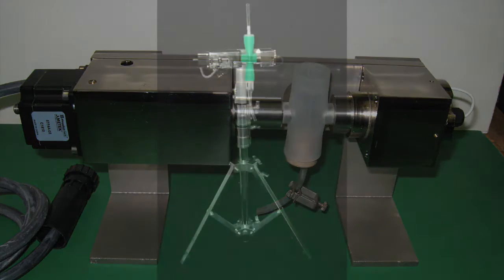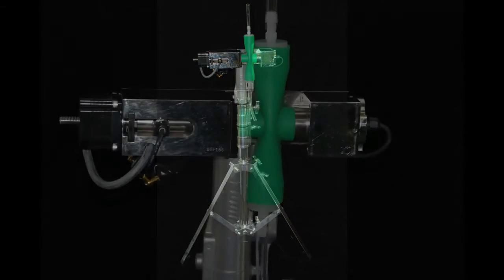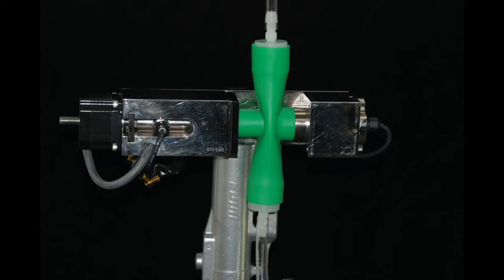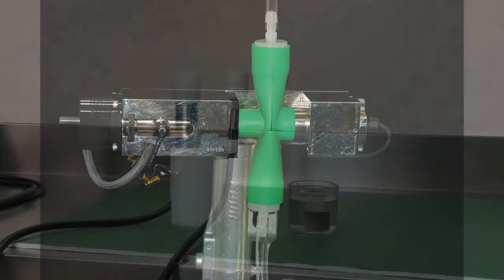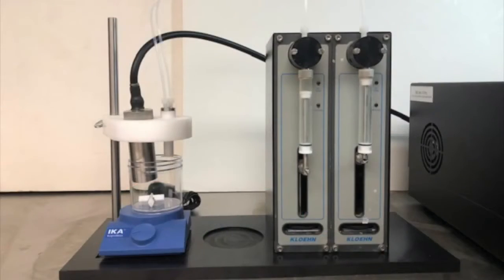If particle size measurements are to be made online, we can use this setup, which utilizes a rubber cross mold, allowing for continuous flow through of sample. This model is referred to as the DT500. In the case of the DT1210, Zeta Potential measurements can be made outside of the acoustic sensor sample chamber, either using the ZP cup accessory, dipping the probe directly into the sample, or using an alternative ZP sample chamber.